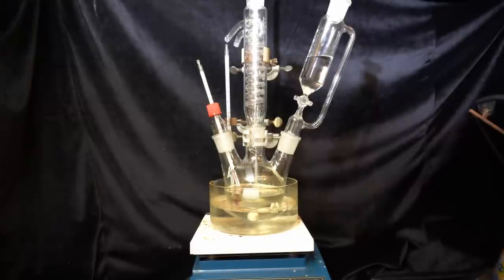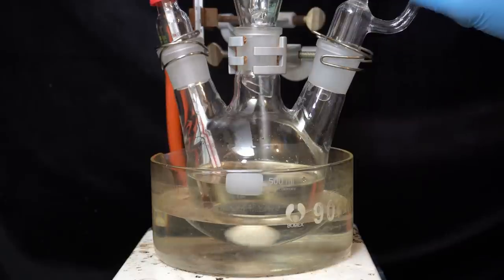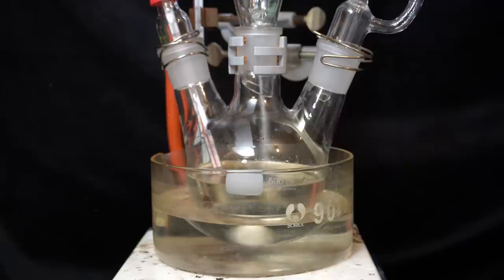The addition of the methyl iodide is very exothermic which is why I added an ice bath, and just in case I also installed a reflux condenser on top. During the addition I will aim to not let the temperature rise above 30°C. This serves mainly to prevent the methyl iodide from boiling but it might also limit some side reactions.